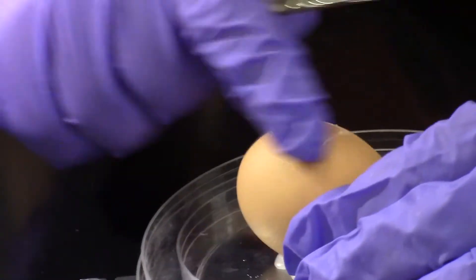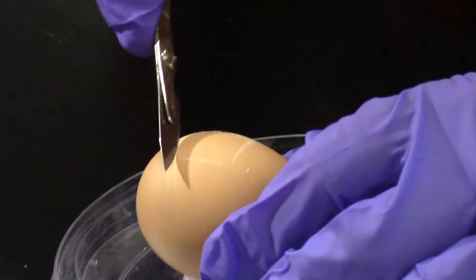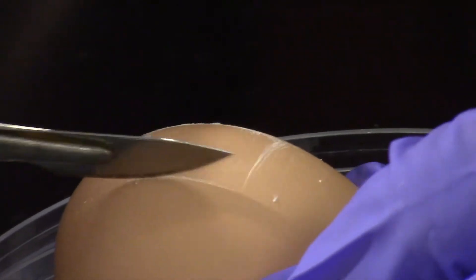If you want to zoom in, you can see the nice little square I've cut here. This will be our window, about two-thirds of the way through the shell at this point.